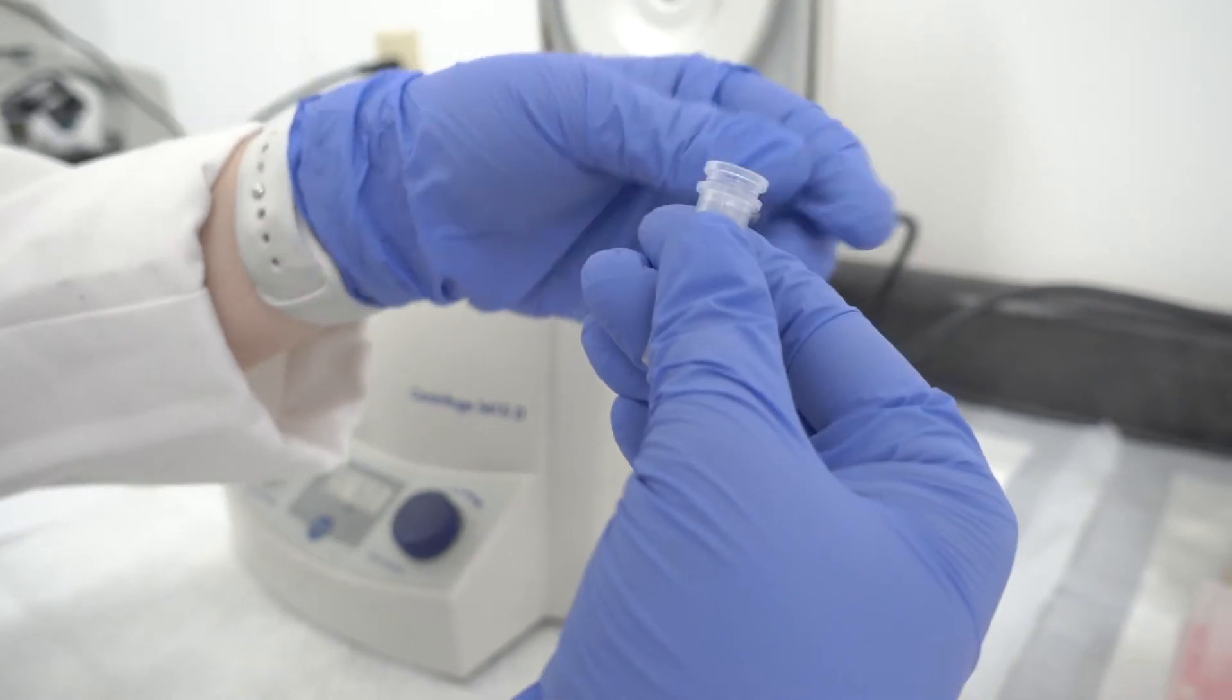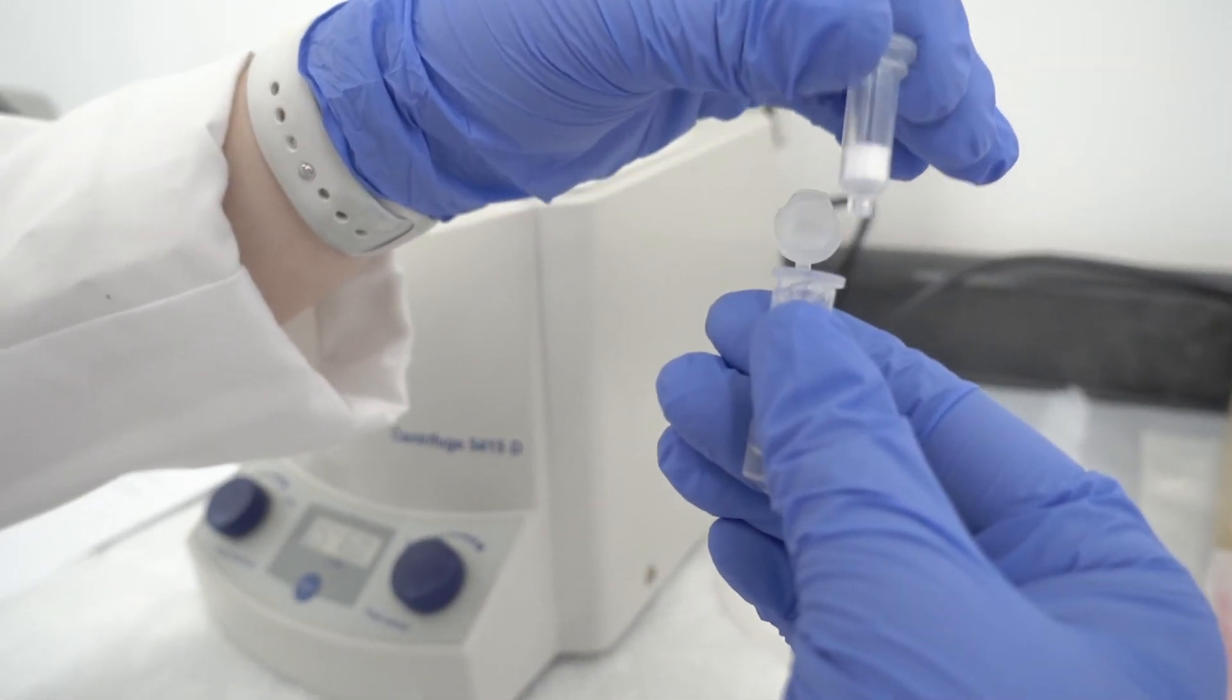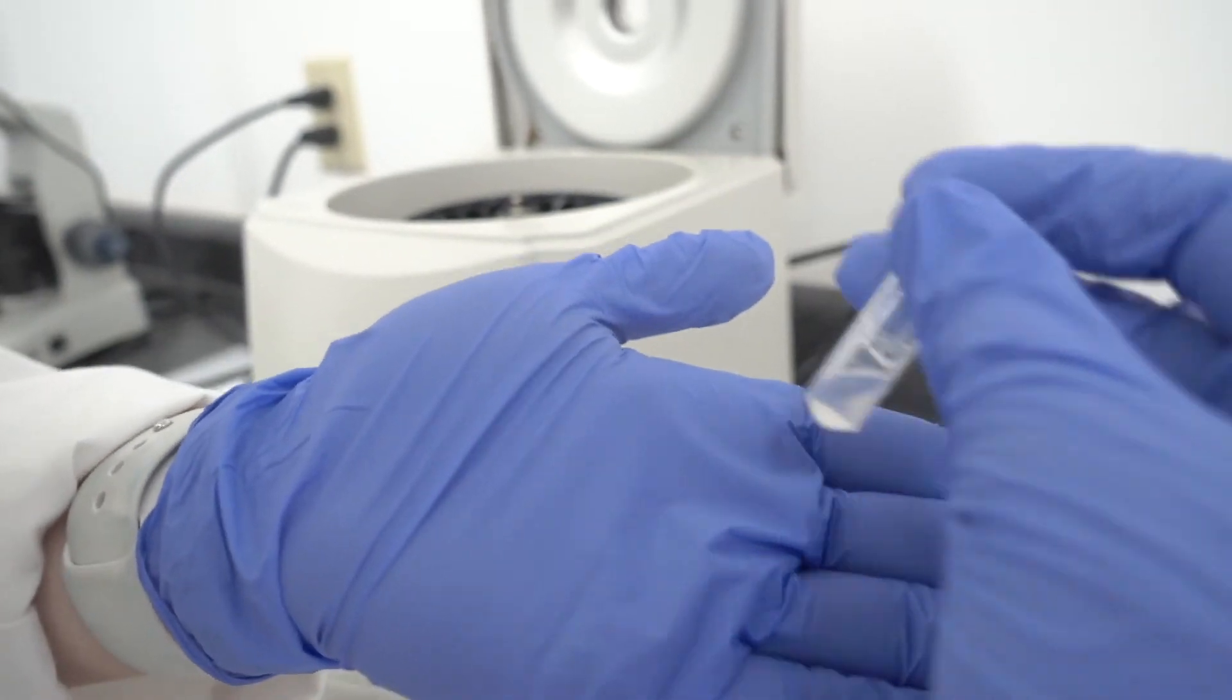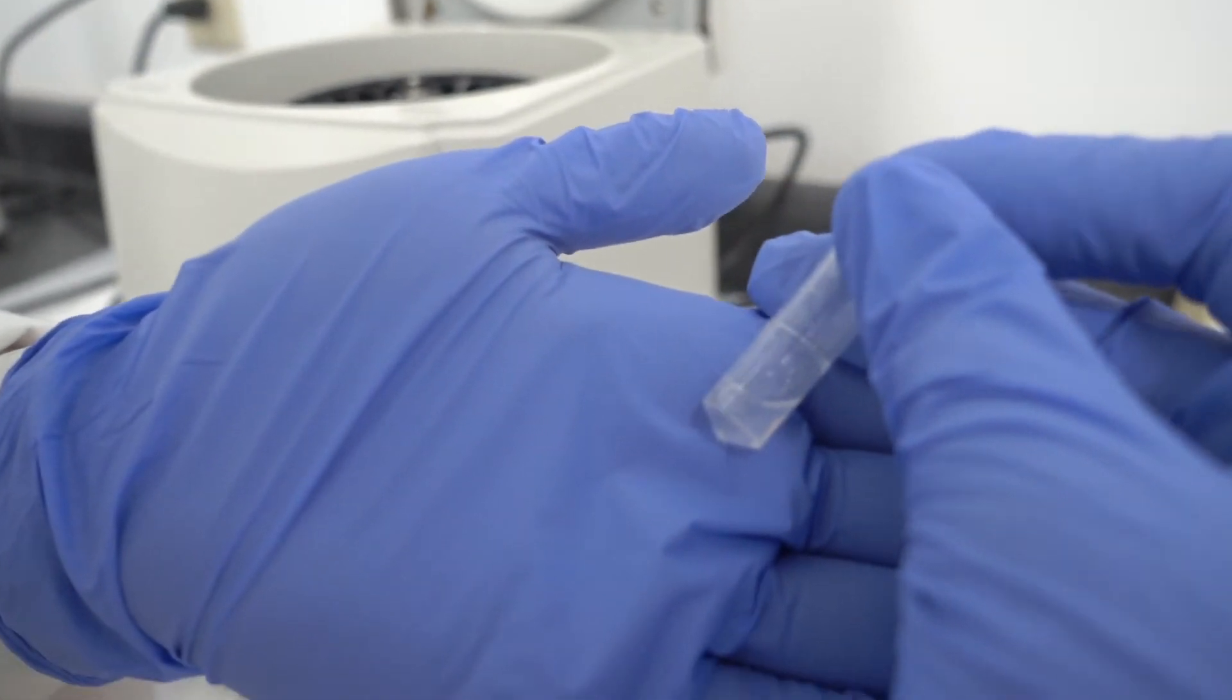Now once we take out this filter, all we have left is the cell lysate solution and it's non-sticky and ready to be analyzed.